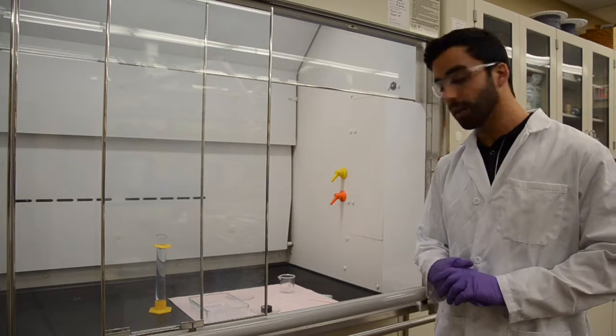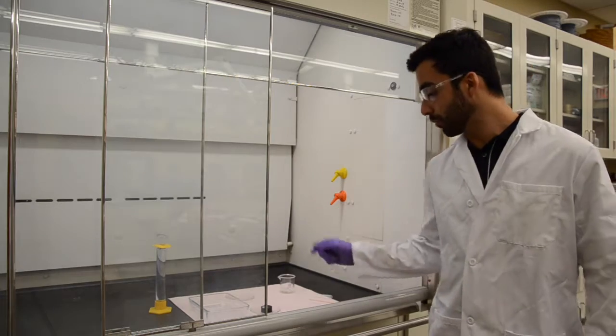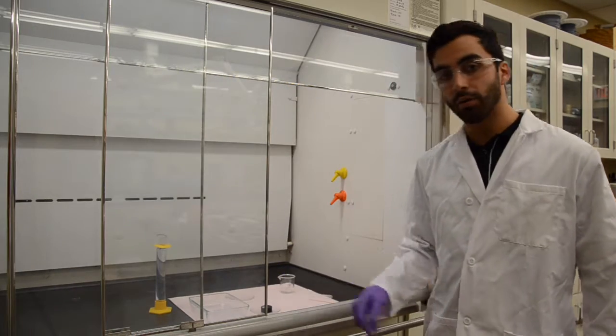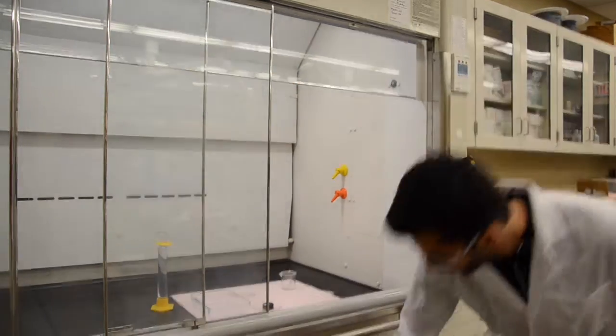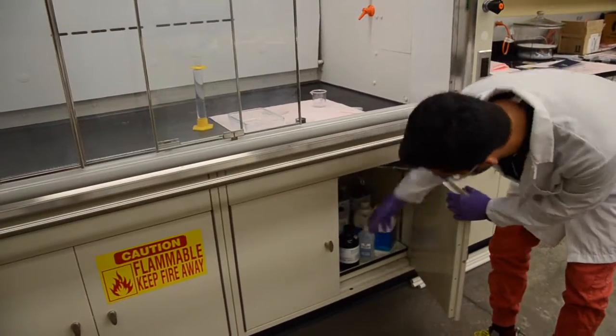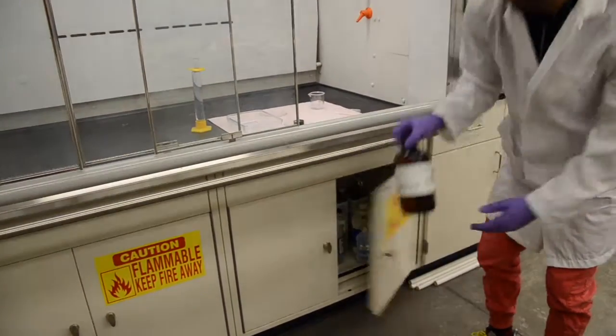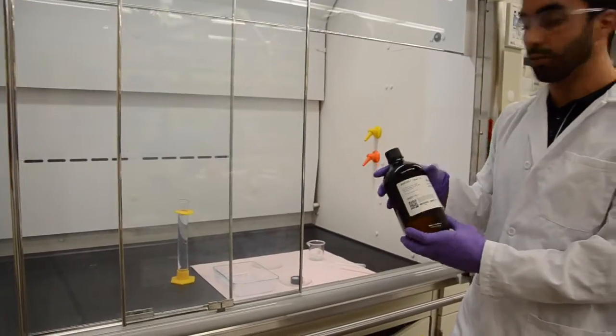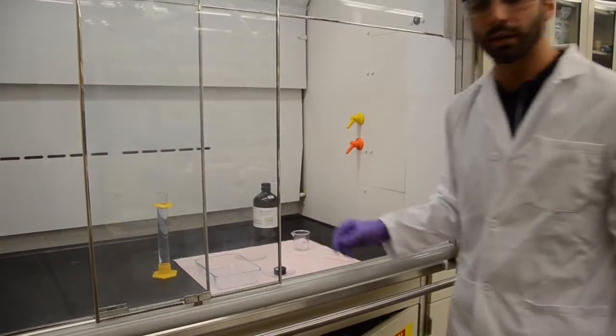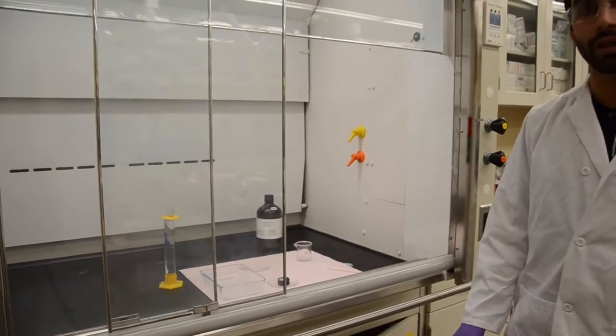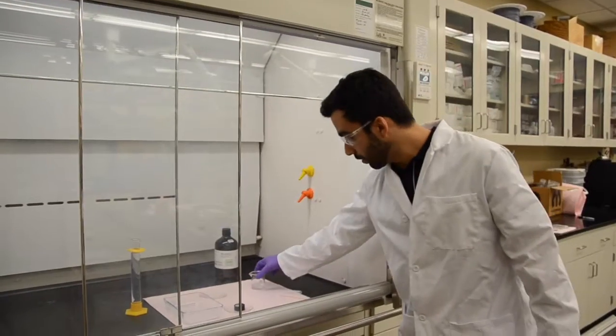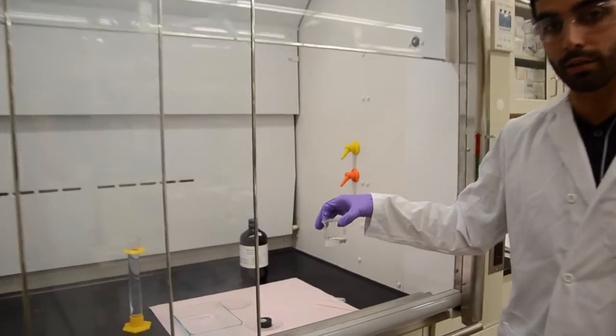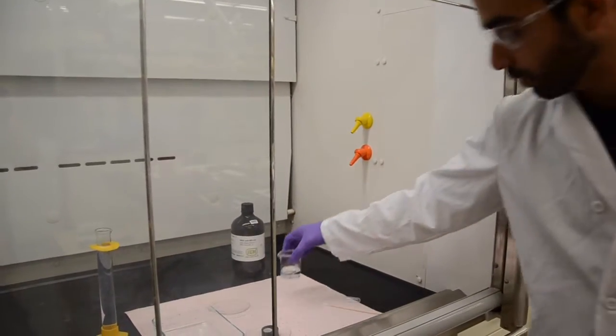Hello, here we are doing the etching of the sample. For etching, we're going to use a nitric acid solution. The nitric acid solution can be found down here. As it comes in the bottle, it's a 50% nitric acid solution. Since we're doing an aluminum, we're going to dilute that solution down to a 4% nitric acid solution. Here we have already the diluted nitric acid solution, 4%.